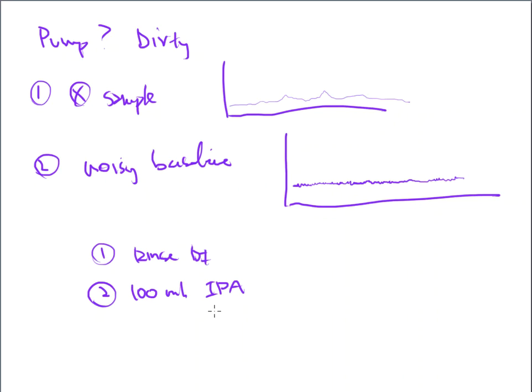Some people do use methanol. That's typically okay. I've used methanol before in the past. No big issues with the methanol that I've seen, but IPA is probably a little bit easier, a little bit cheaper. Methanol, though, does as good of a job, and we have it all the time, it seems like, in our instrumentation room, because we use it to clean other stuff too. And finally, number three, we're going to rinse one more time with DI water, just to rinse off any extra stuff that might be present.